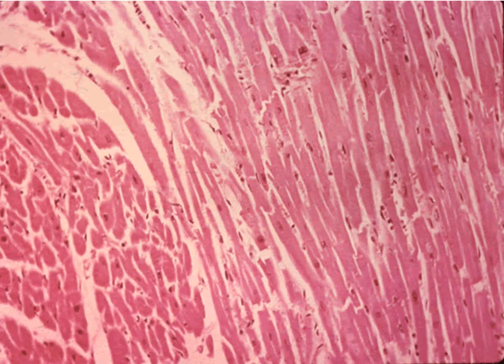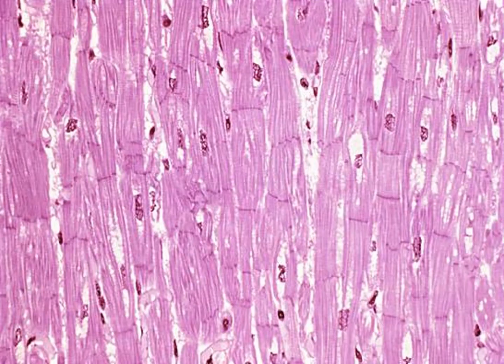Here's another set of branching cells. That branching pattern has to do with the fact that a nerve impulse must travel rapidly through heart muscle tissue, causing those components in the heart, the atria and the ventricles, to contract together as a unit. So this branching pattern is unique to cardiac muscle tissue. Just another view of those separate but branched cardiac muscle cells.